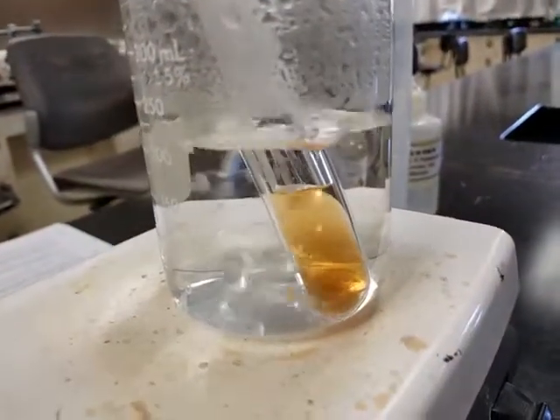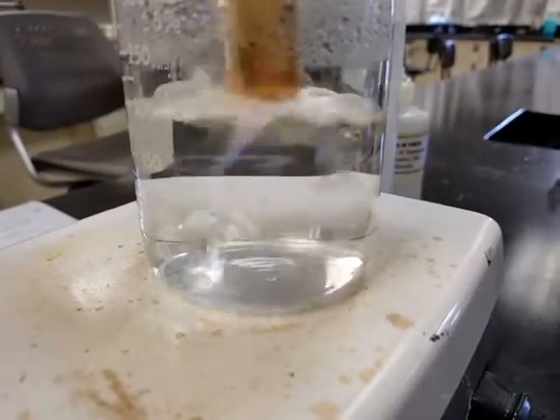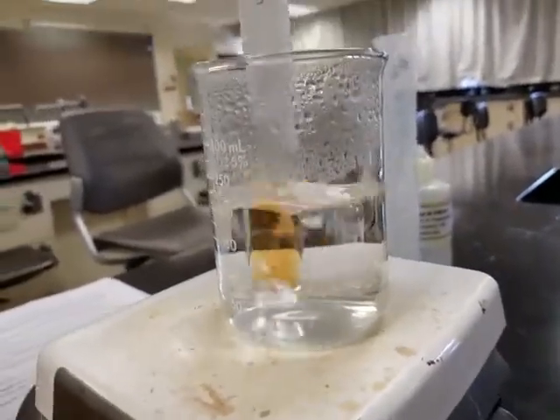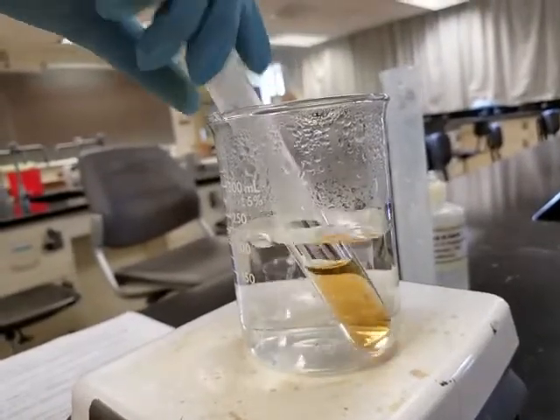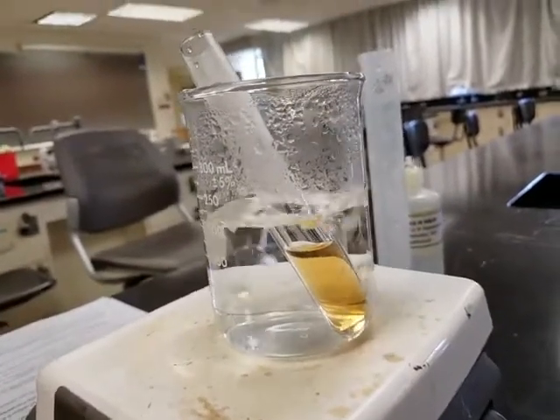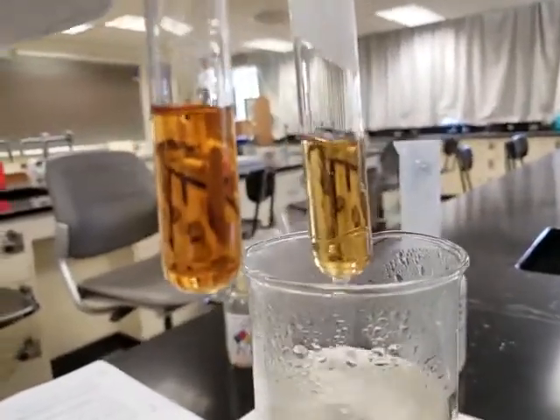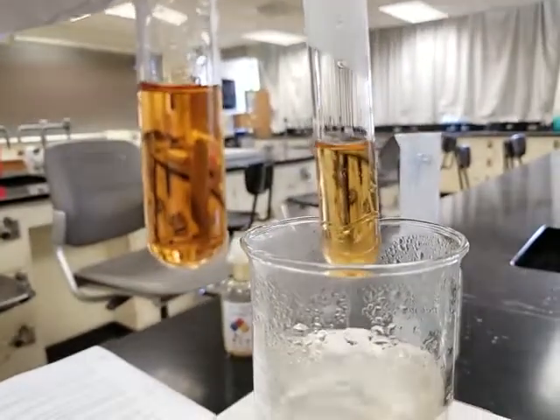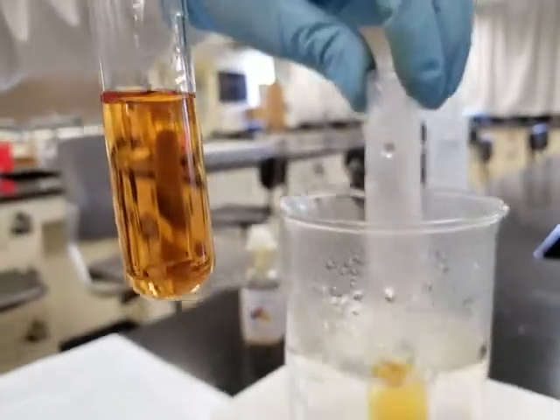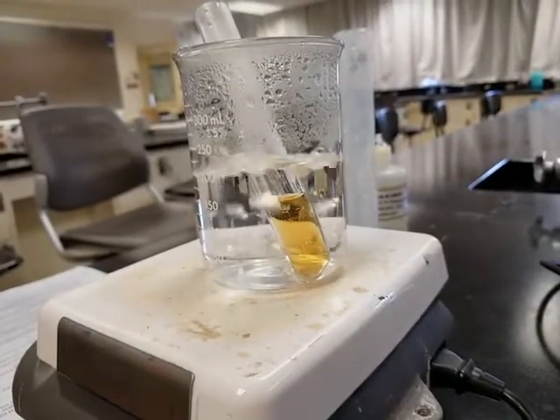Do you see any color change? Yes or no? You can also give it a good stir so everything is heated to the same temperature. Do you see anything? Again, we're going to compare it with test tube 1, where nothing happened. Do you see any differences? Did it get lighter, darker? What happened compared to the original test tube when you placed this stock solution into high temperature, i.e. boiling water?